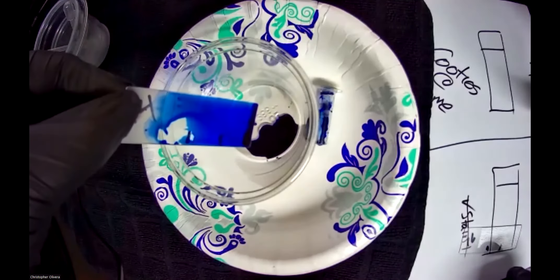Now your slide should be relatively clean — and you're done. That's lab 14: rinse it out once and it should be good to go. There may be a little bit of stain on the edge, but that can be cleaned off with a paper towel. Wipe it off, and done — put it back over there and save it for when we go into the lab session.